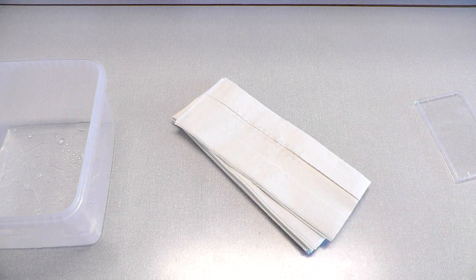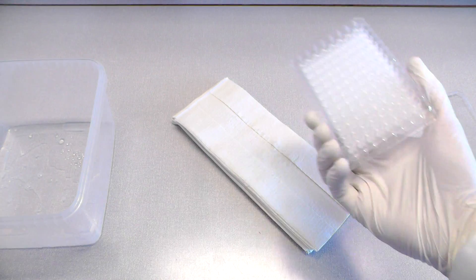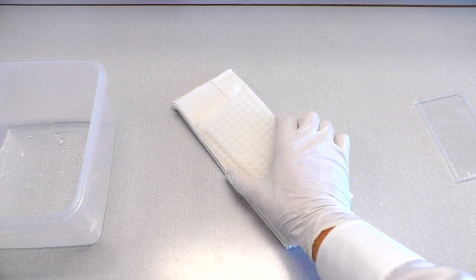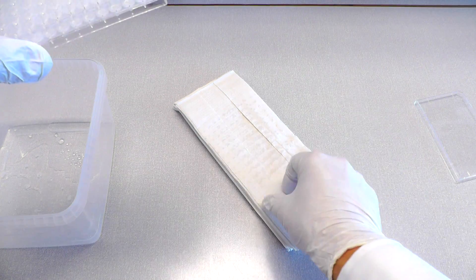This step is very important. If too much fluorescence enhancer is left in the plate, the analysis can be negatively affected. As a result, you need to be quite thorough in removing it but not excessive.